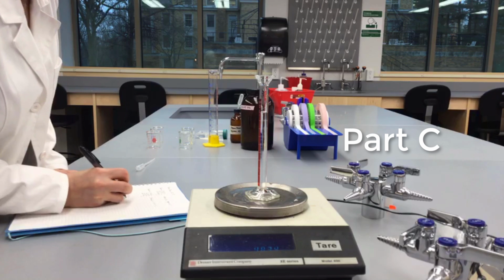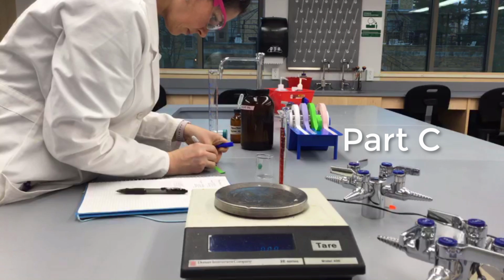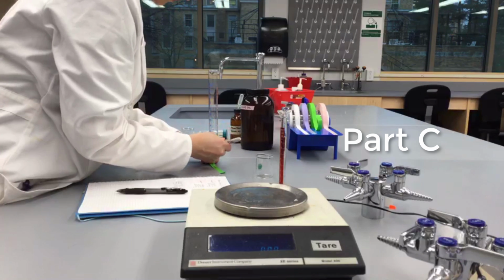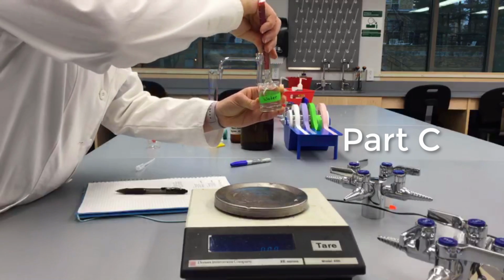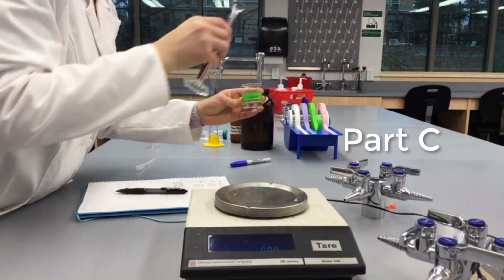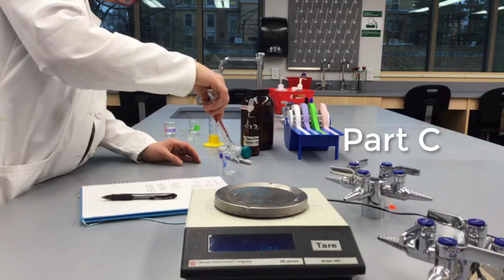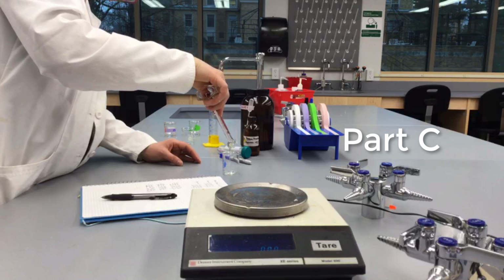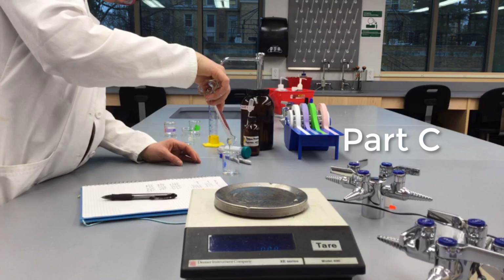After you do this for one liquid, pour that liquid into a clean beaker and set it to the side. Make sure your beakers are labeled so that you don't mix up your liquids. And make sure you clean the graduated cylinder well with soap and water between measuring each liquid. Some of these liquids are particularly difficult to clean and to pour, so please be patient when pouring viscous liquids and make sure you clean your glassware well.